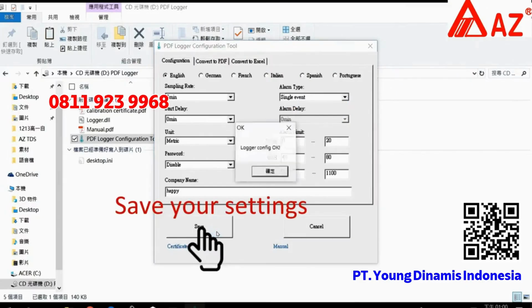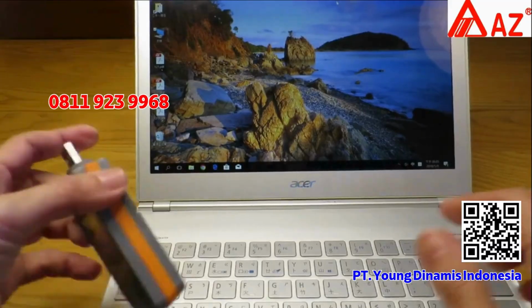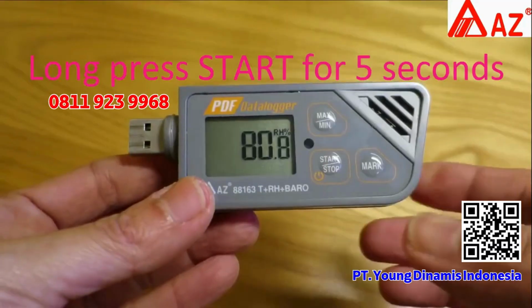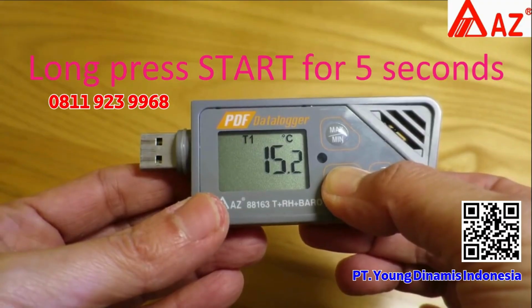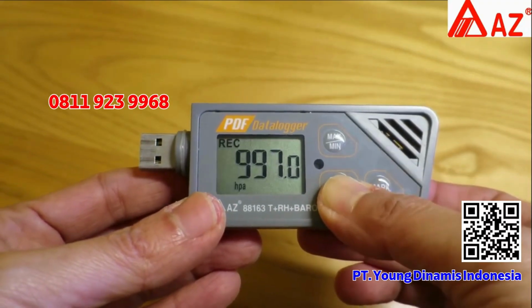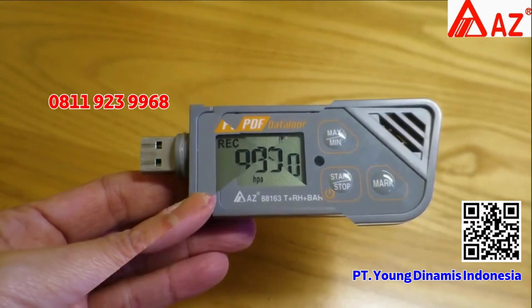Once you complete, press Save to confirm the settings. Close the window and remove the logger. Long press the Start key for 5 seconds. Green LED lights blinking and REC flashing means the logger is activated.